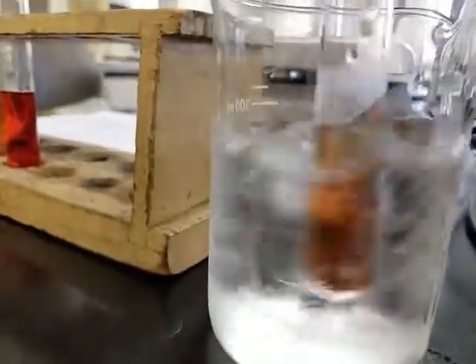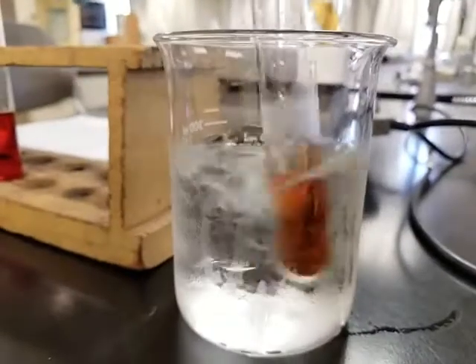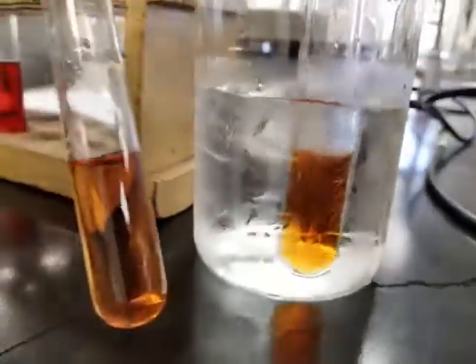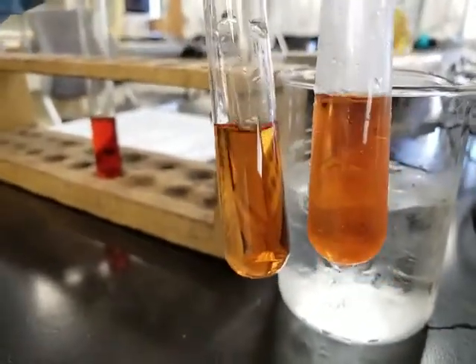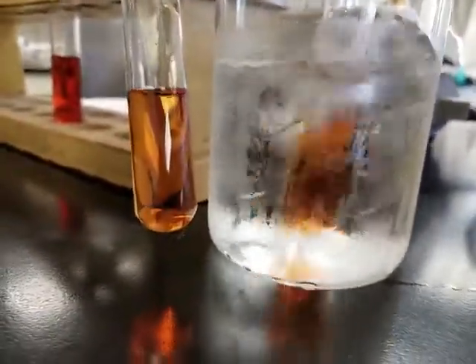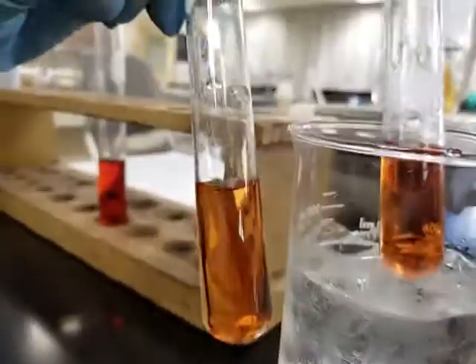And there's droplets everywhere. But I'm going to take it out so you can have a good comparison. And in the video, the color change might be subtle, I hope it turns out all right. But I'm gonna lift it out and place it next to our control, okay? So are you guys ready? What do you think? Is there any visible change? And just write down what you think, okay? Just write down what you think. Is there any visible change?